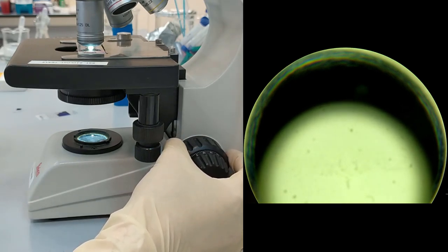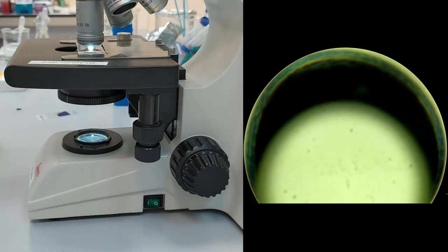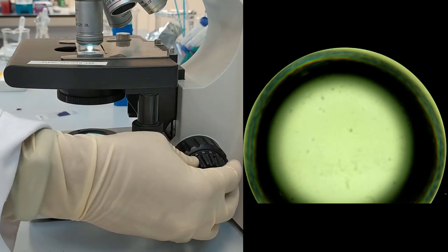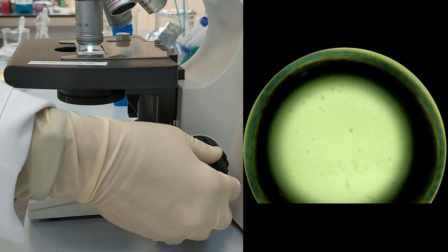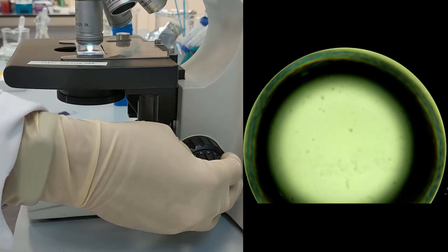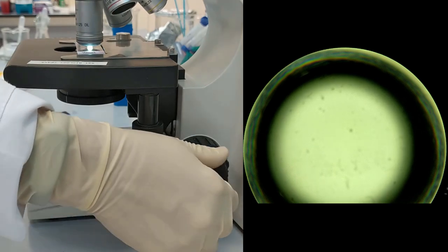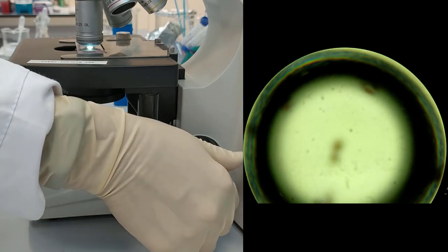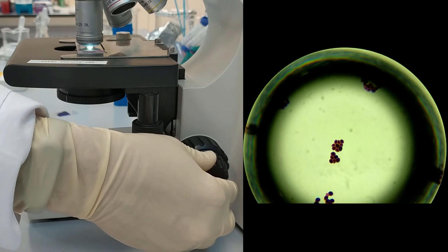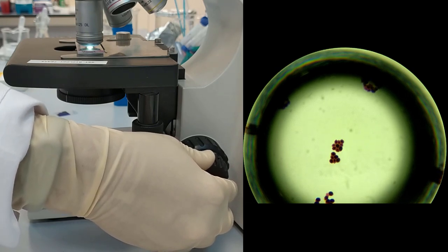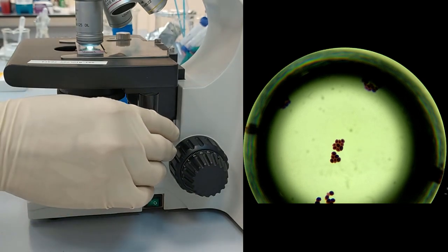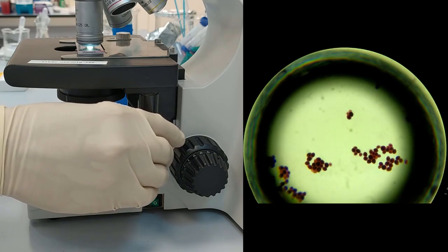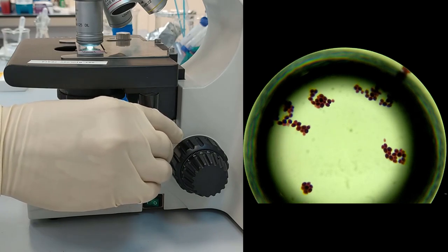Now you go a little back and start working with the small knob. You can also use the stage controls to find the best views for yourself.